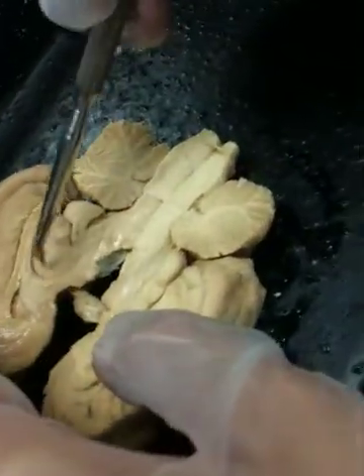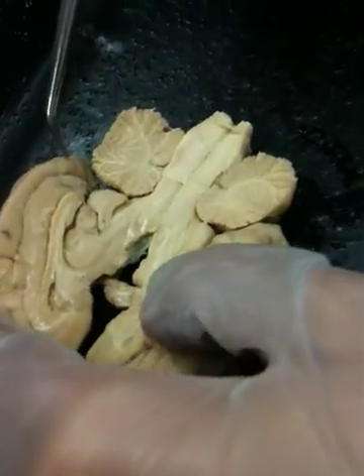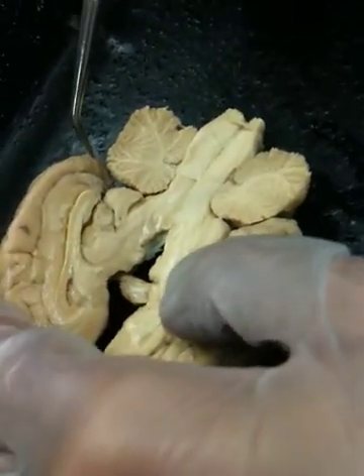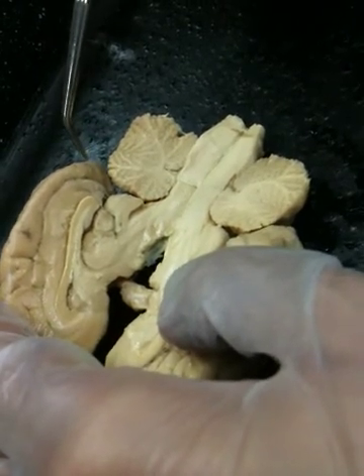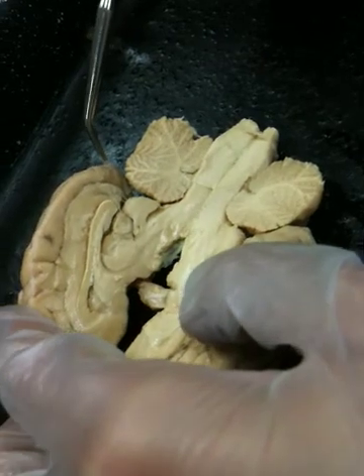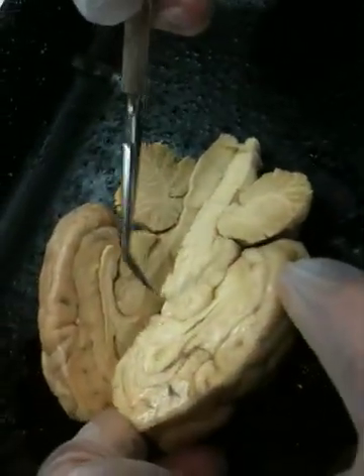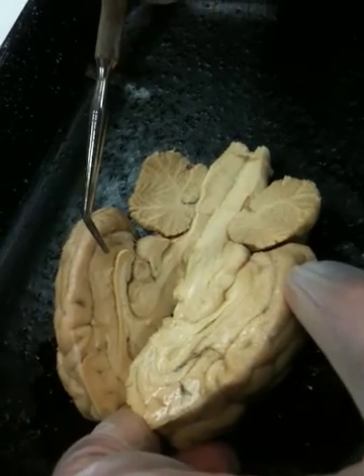It's a tract, so it's a place where this half of the cerebrum is being connected to the other half. And it's just a small white dot. If you've sawed a lot in making your sagittal section, you'll probably lose it. But if you have a good straight section, you can probably locate it. It's kind of down here as the fornix comes down, you find it right down there at the tip of the fornix. That's the anterior commissure.